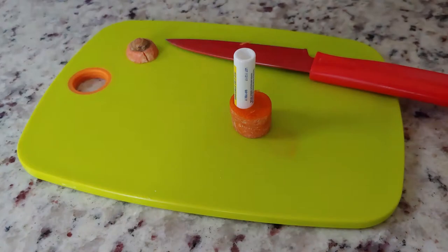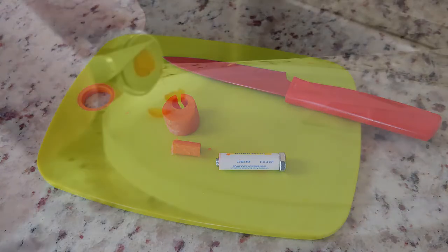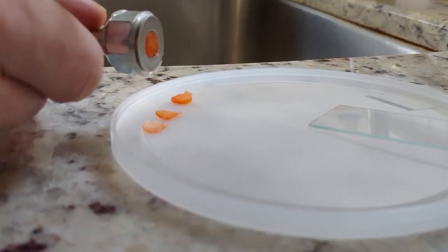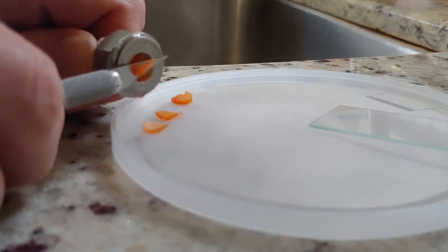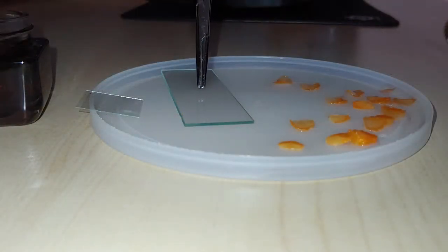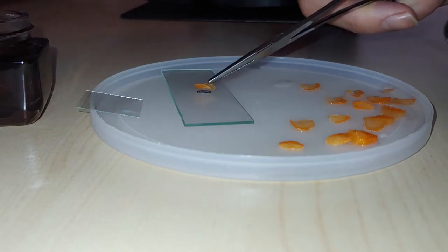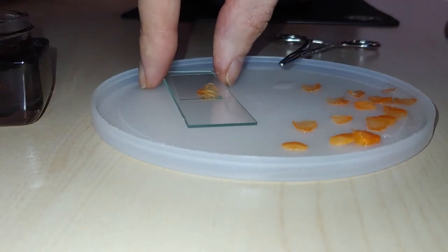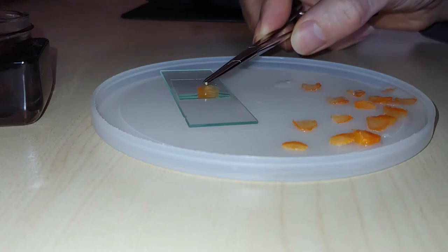So I used another one of those plastic tubes on a piece of carrot to get a plug out that fits the exact shape, and we are in business. I put that plug in there, and as you can see, I can use an exacto blade to just cut a thin section. I just turn that bolt a little bit, and then when I cut again, I get another thin section. Perfect. I did that for a little while. I'm making a wet slide preparation — put one of the little slices on there, get a little bit of water on top so that way we can get the proper refractive index through our entire system. Then I'm going to put the cover slip right on there, tap it down, and we're good to go.